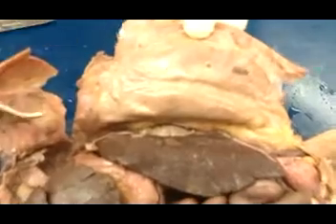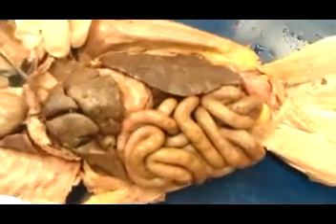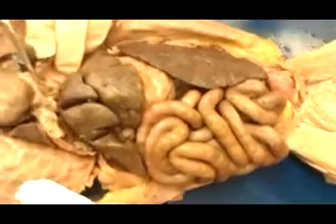Now up against the wall here of the abdominal pelvic cavity, that shiny membrane is called the parietal peritoneum. The visceral peritoneum would be on the surface of these organs. Just below the diaphragm, you can find it here, it's a little fat. Right there is the falciform ligament, and that attaches the liver here to the underside of the diaphragm.